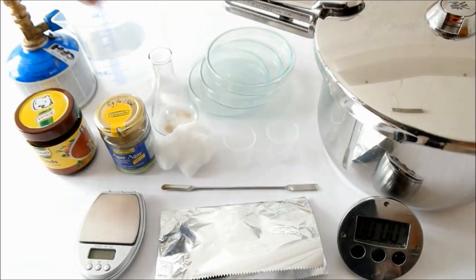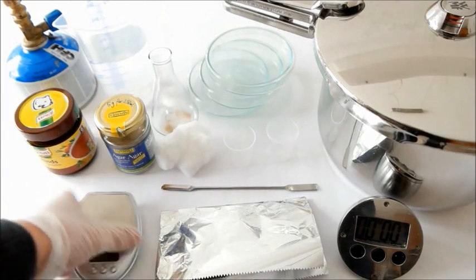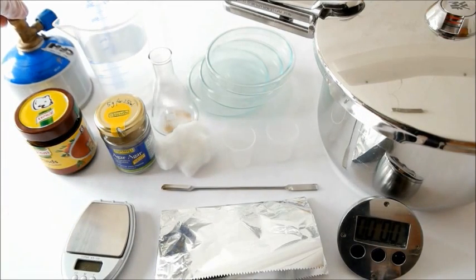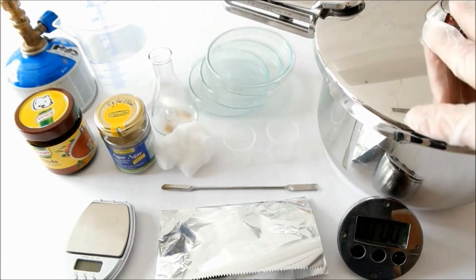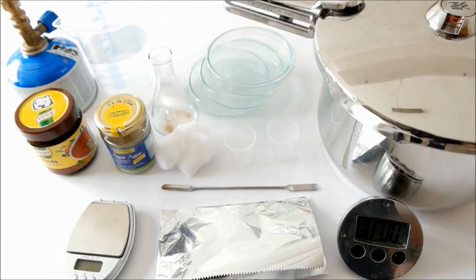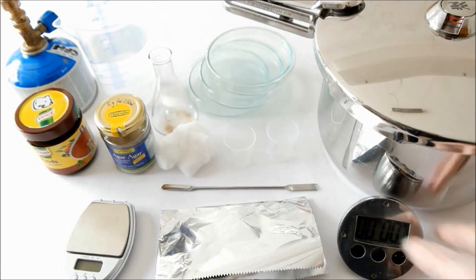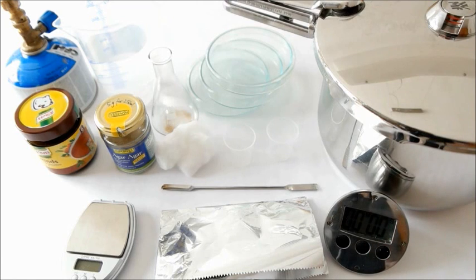You need some water and a scale and a Bunsen burner, and of course a pressure cooker which you use as an autoclave to sterilize the petri dishes and the Erlenmeyer flask. Furthermore you need a clock to measure out the time.